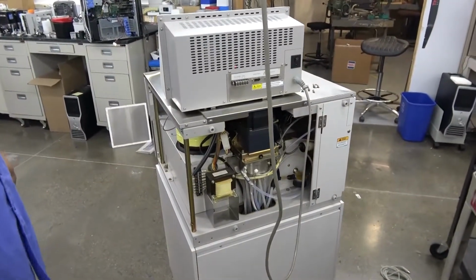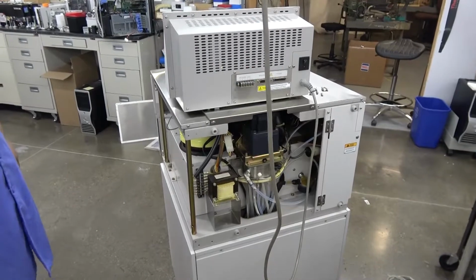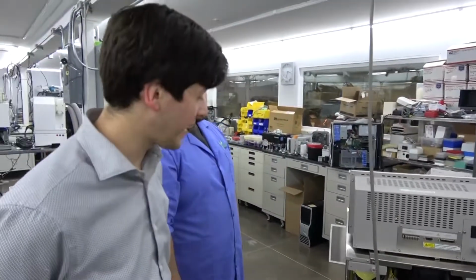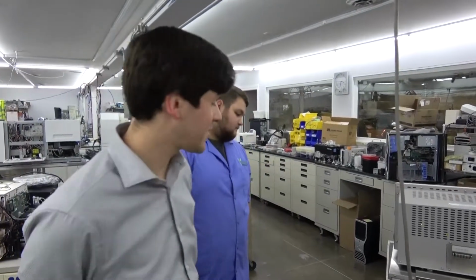I really think it looks great. That's a good solution. So there you go. Custom step down to 110 conversion. That looks factory right here at New Life Scientific.